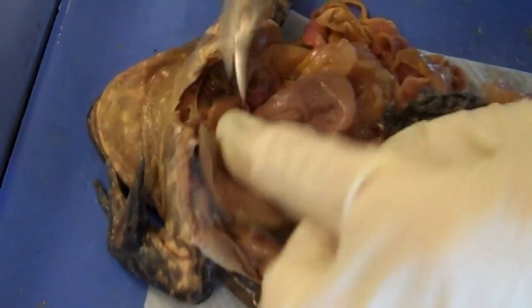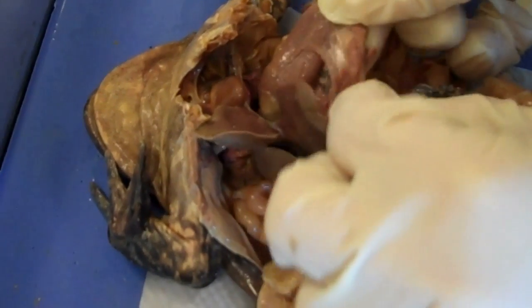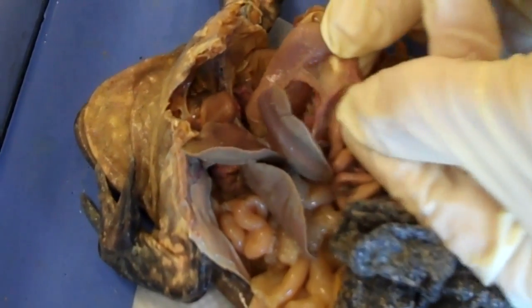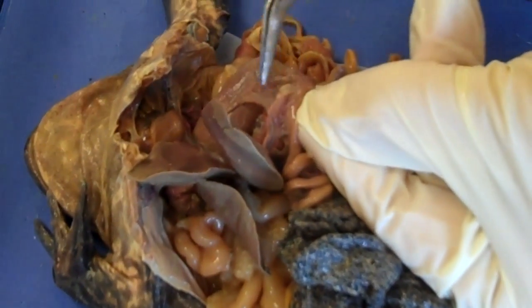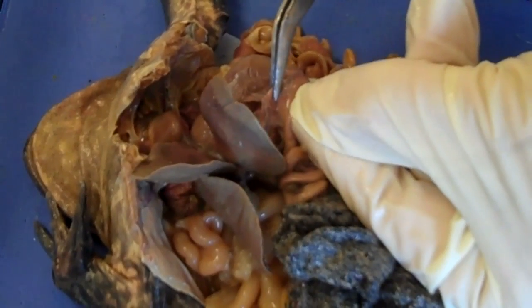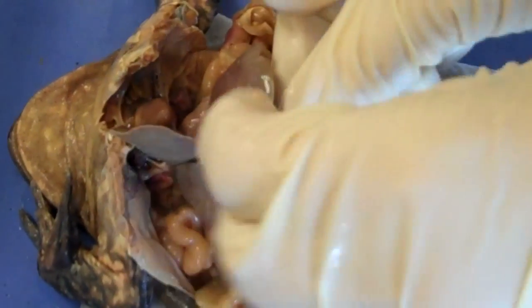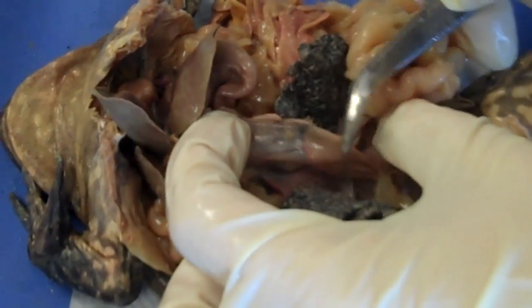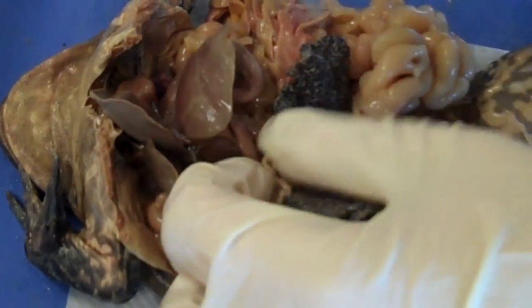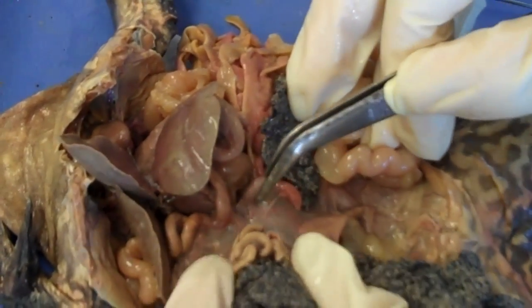Going into the small intestine — this is all small intestine here. In between the stomach and the small intestine, you will find the pancreas — just this little thin strip of tissue right here. The small intestine leads to the large intestine. Beside the small intestine, you should find the spleen — there's the spleen.